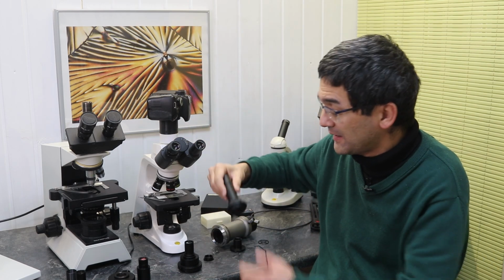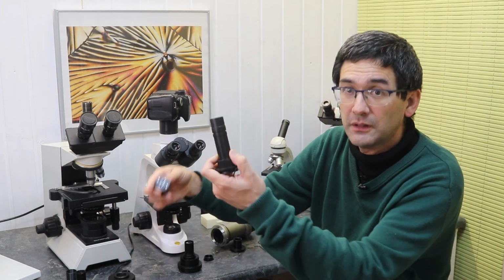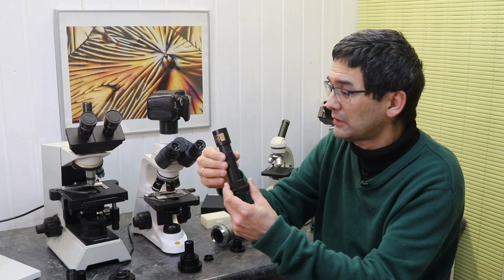Instead, you have this fancy solution over here for microscope cameras, like this one over here. But what about DSLR cameras? So this is the thing that I just want to clarify here.